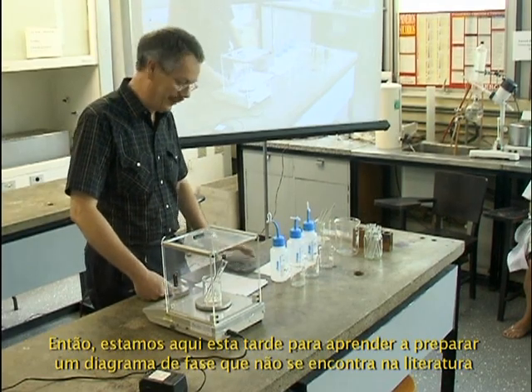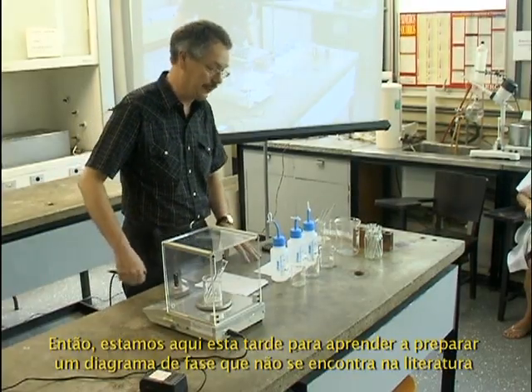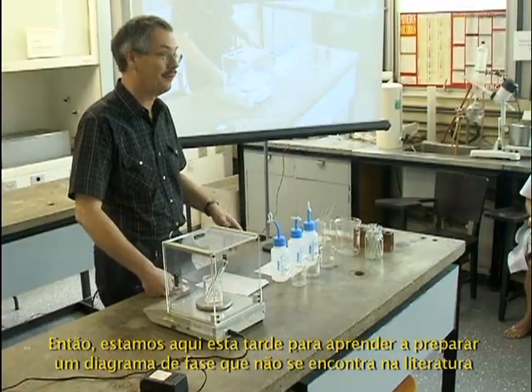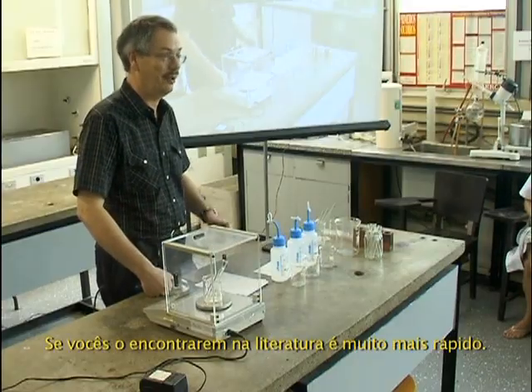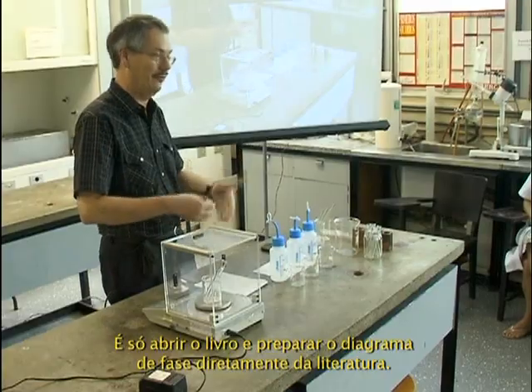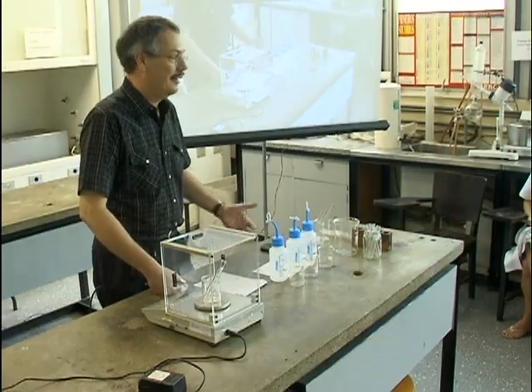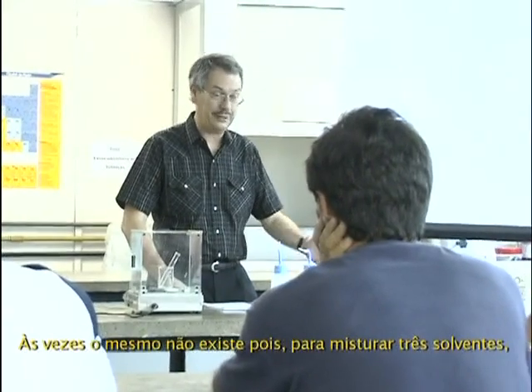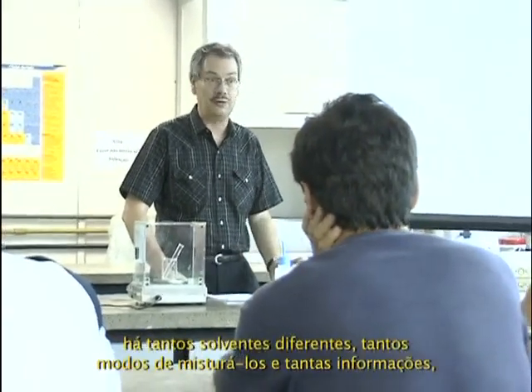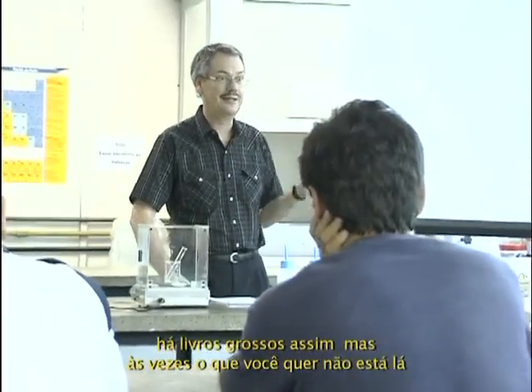So this afternoon we are here to learn how to prepare a phase diagram when you cannot find it in literature. If you can find it in literature, it's much faster. You take the book, you open the book, and you pick up the phase diagram directly in the literature. Sometimes it doesn't exist because to mix three solvents, there are so many solvents and so many ways to mix them that there is a book this thick and the one you want is not there.